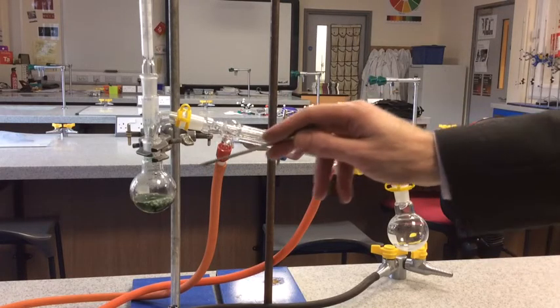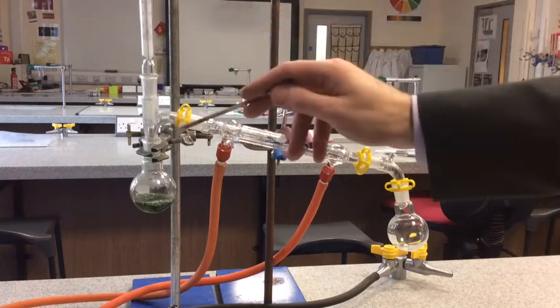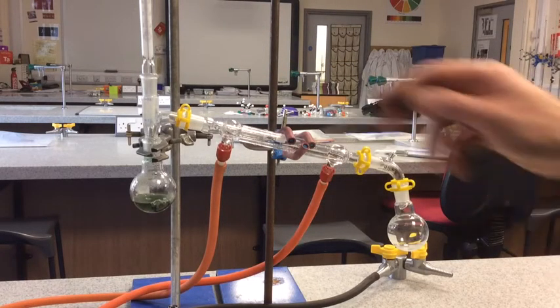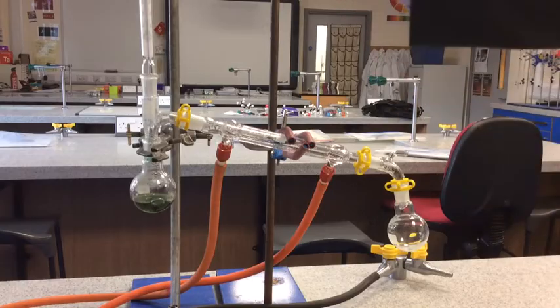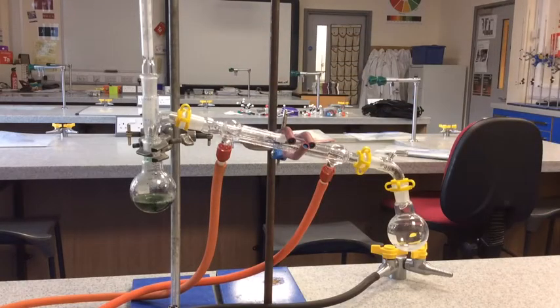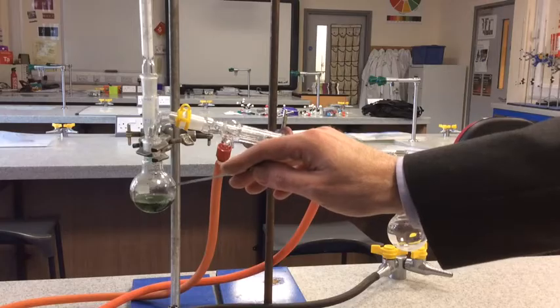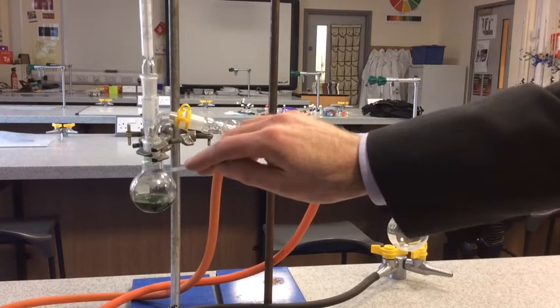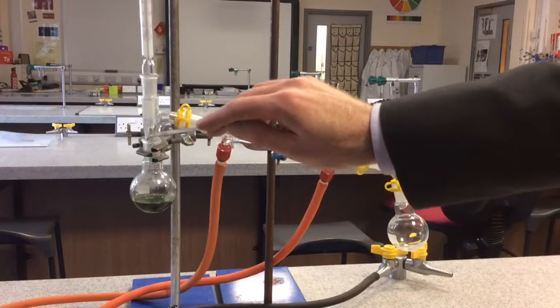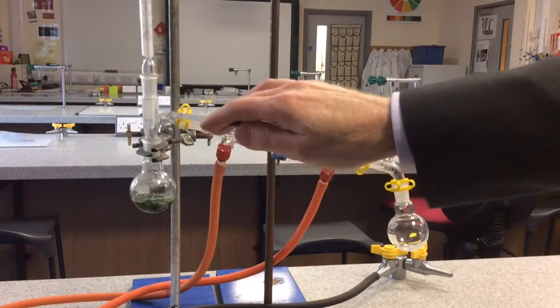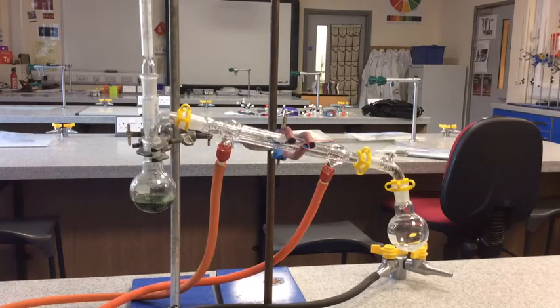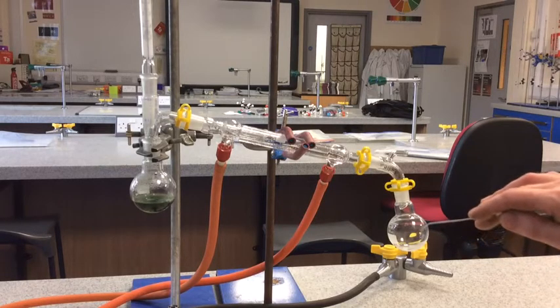Remember when we had the condenser in the vertical position, the volatile aldehyde that was produced wasn't able to escape, so it rose up the condenser and then because it was cold around the outside of the condenser it dropped back down again. In this setup, in distillation, that's not the case. The aldehyde, as it forms - you can see little bits of vapor condensing on the top of the flask there - eventually the vapor will reach to this part here and its route out will be down the condenser. Hopefully when we give it a bit more time we'll start to see some product forming in the flask on this side.